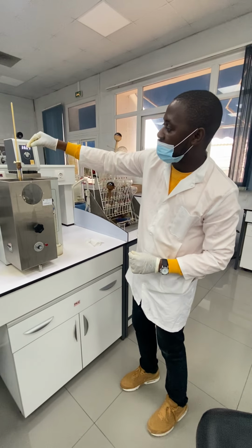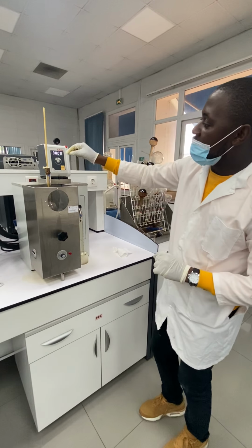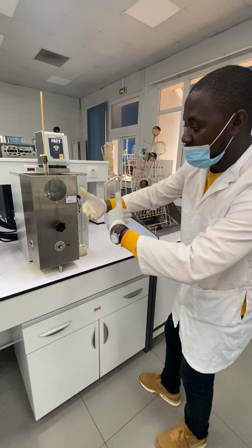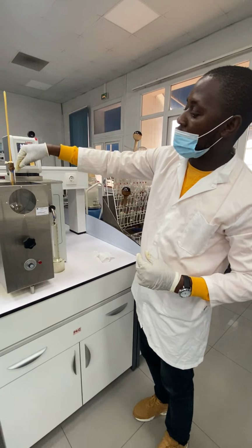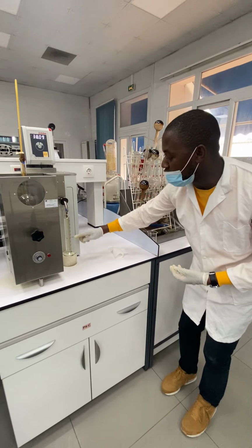We put the products here, which we call kerosene and gasoline, and we're going to turn it on here, and it's going to start. When it starts, it starts to move, and one part of it, which we call distillate, will come here, and the residual is going to stay here inside. So what we're going to do is measure according to the approved method.